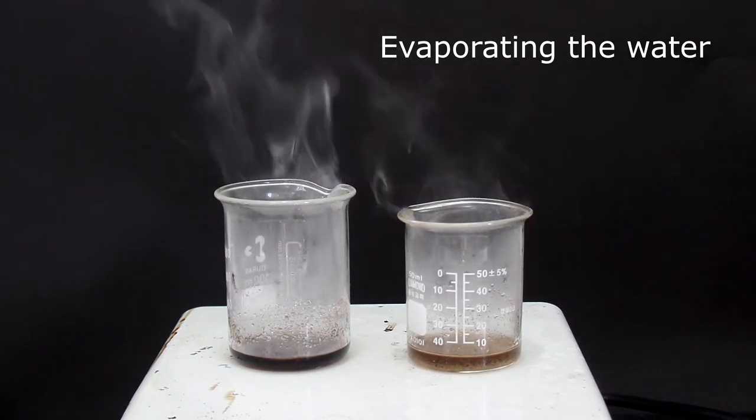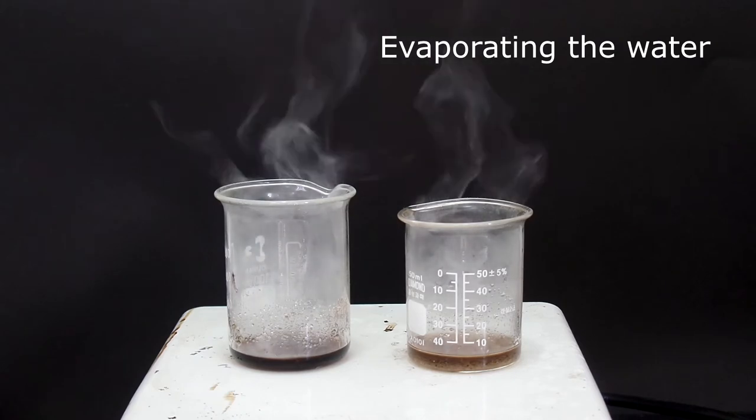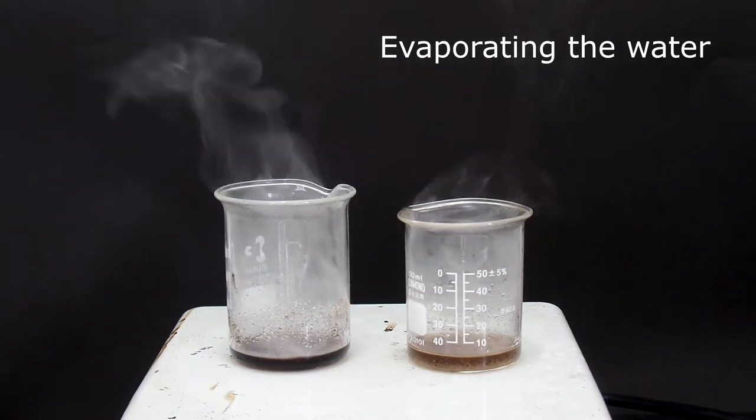Second, silica sulfuric acid is a solid acid, meaning that it can be reused, and it is easier for students to handle.